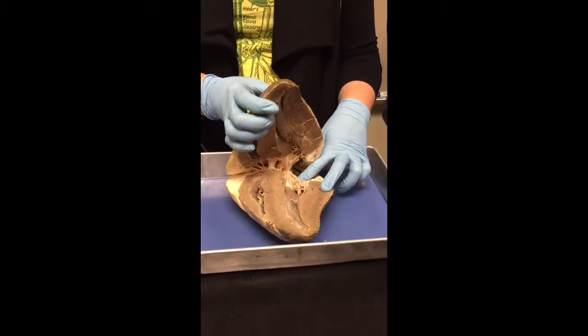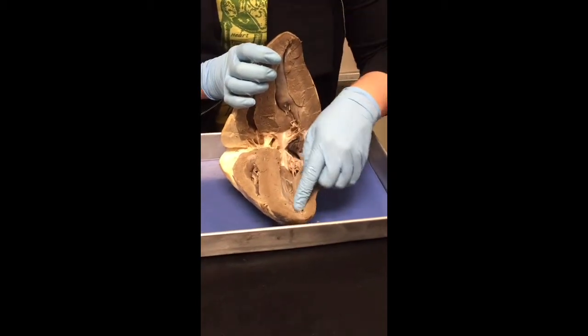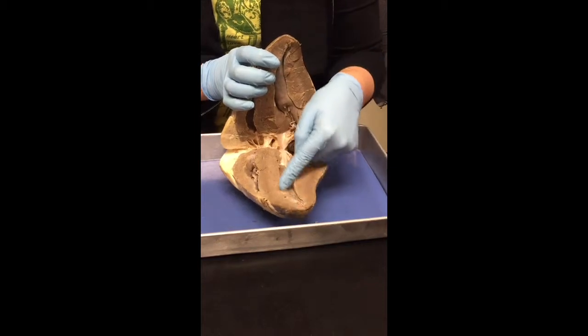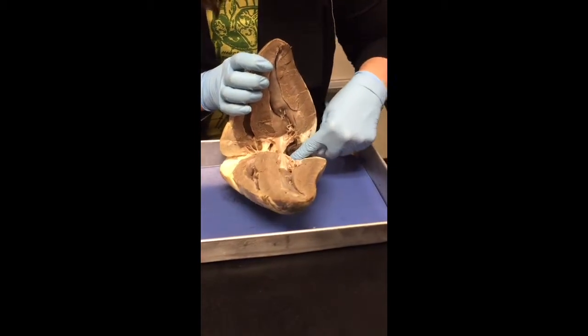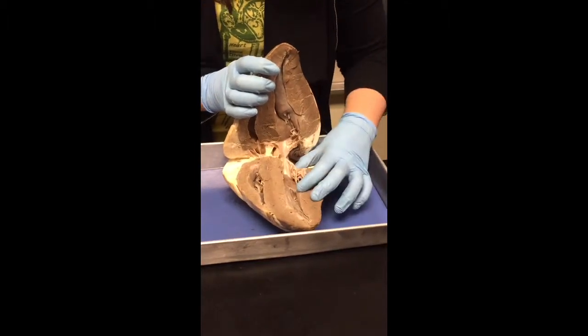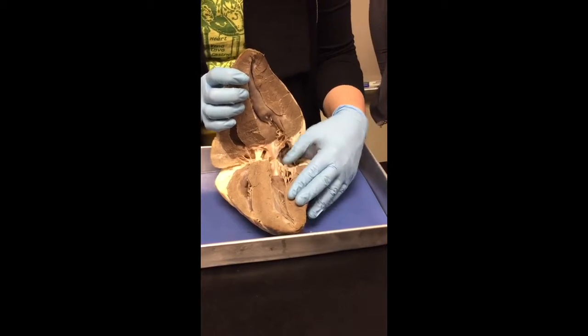The left atrium is going to contract. It's going to push blood down into the ventricles. So think V, ventricle. All right? So here's the ventricle, here's the atria. How do I know where the atria ends and the ventricle begins? It's because you look for these flaps. This is a valve, okay?